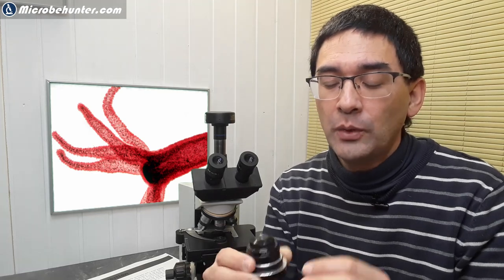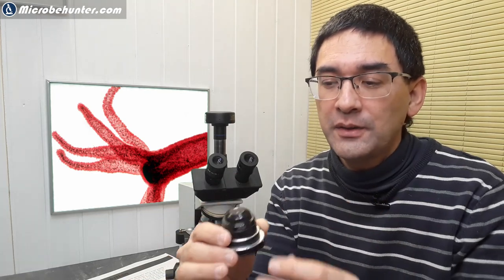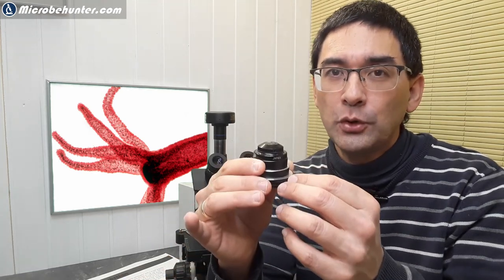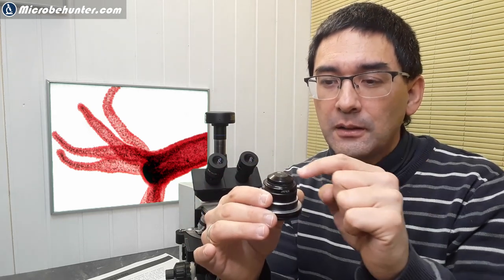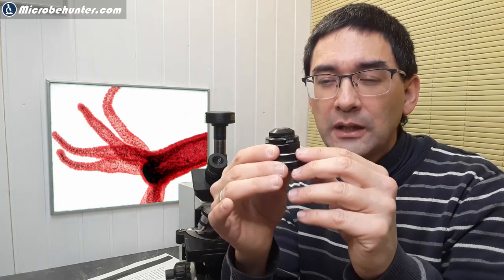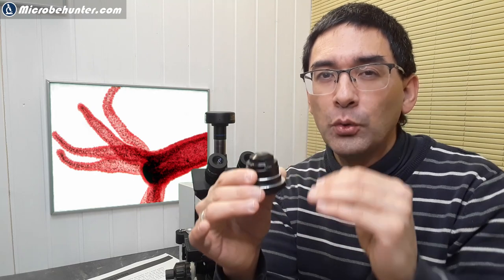That's a separate video. What I want to simply tell you right now is you leave the condenser all the way to the top. If you see a little bit of dust on the condenser, then you can lower it a little bit, and this defocuses the dust a little bit and might give you a nicely cleaner image.